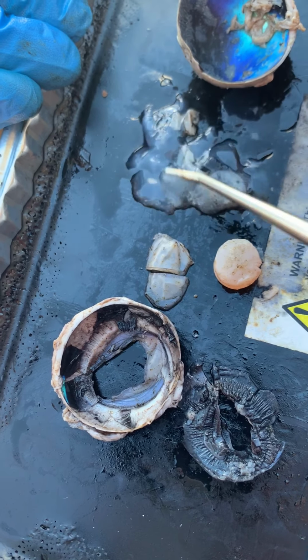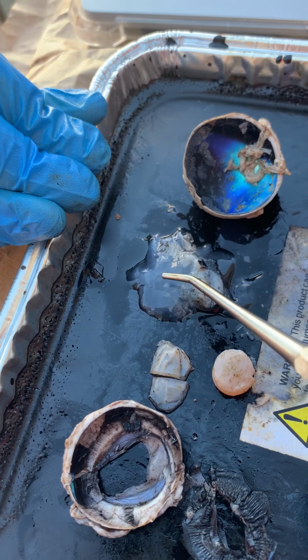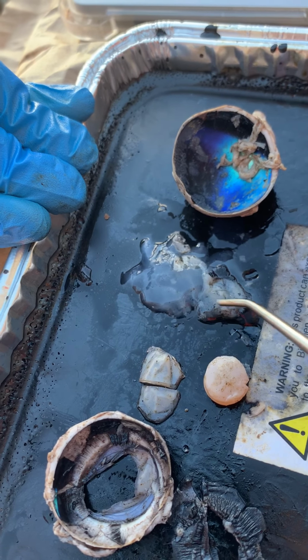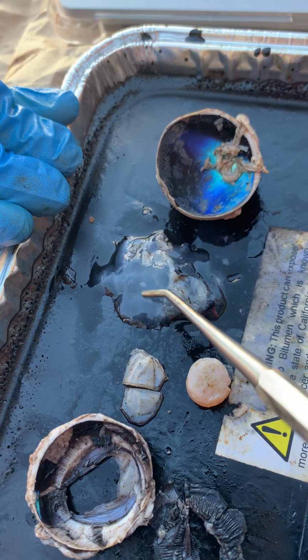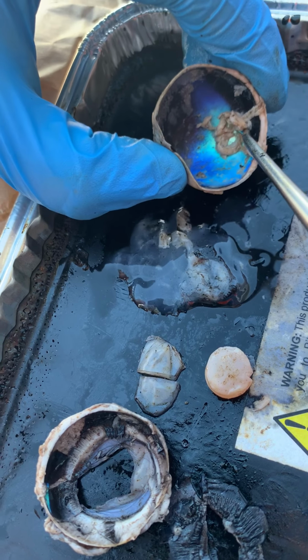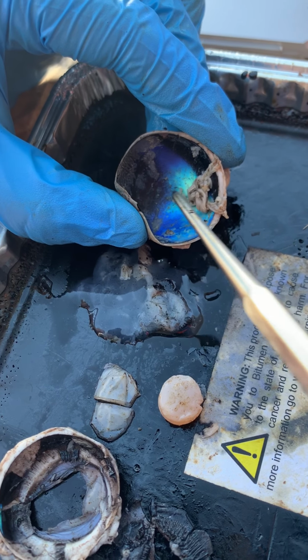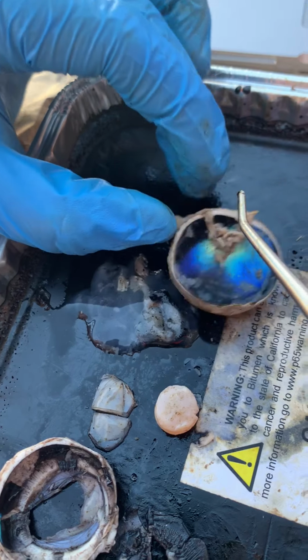The vitreous humor is the gelatinous fluid here, and it's housed in the back of the eye in the vitreous body. The vitreous fluid helps keep the shape of the eye as well as helps transmit light to the retina. And within the vitreous body, we also see the retina, and that's that fibrous stuff right there. That's what receives light from the lens and converts light into neural images to be transported to the brain through the optic nerve.